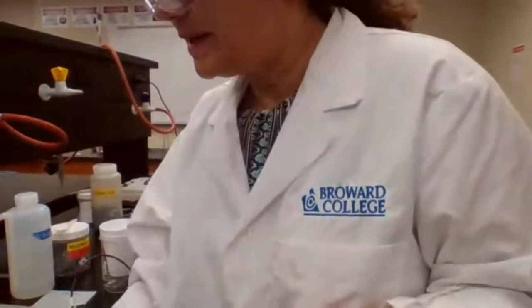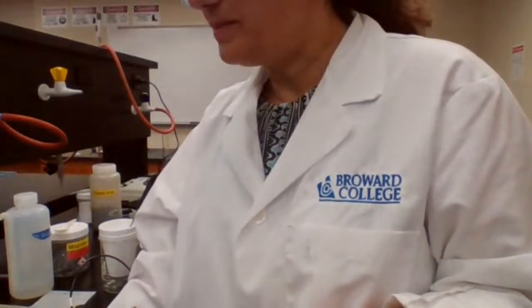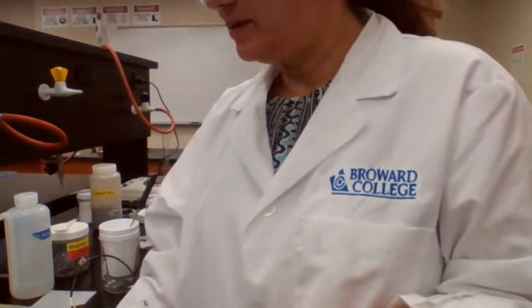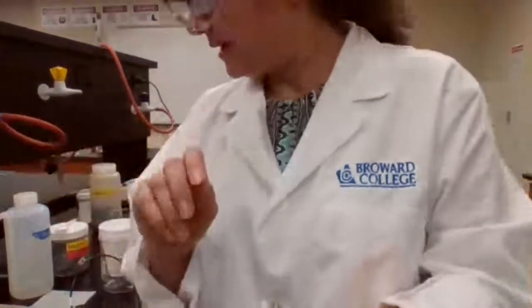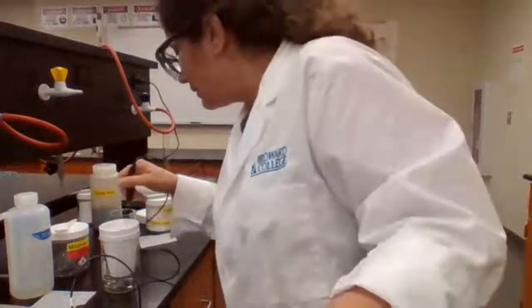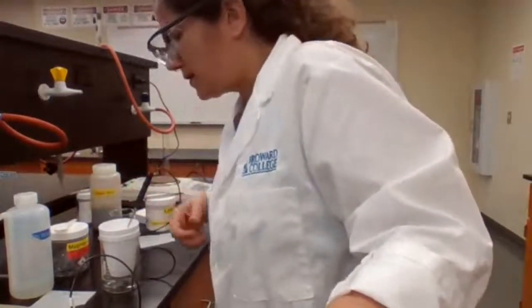You have the specific heat capacity for the reaction mixture, which is assumed to be like water. You have that in the lab manual, you can use it. And everything else is calculation. It was a long reaction, especially the titration part.